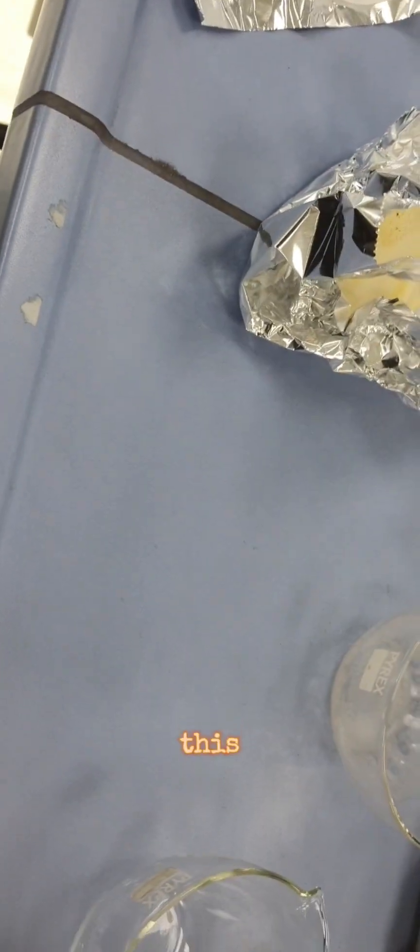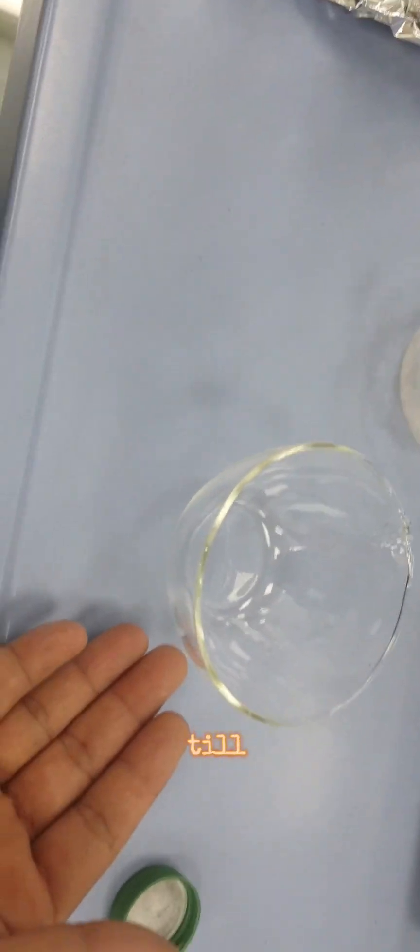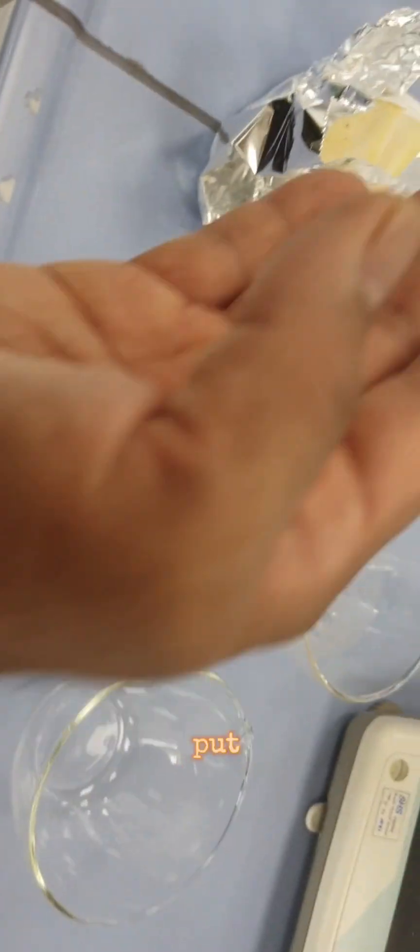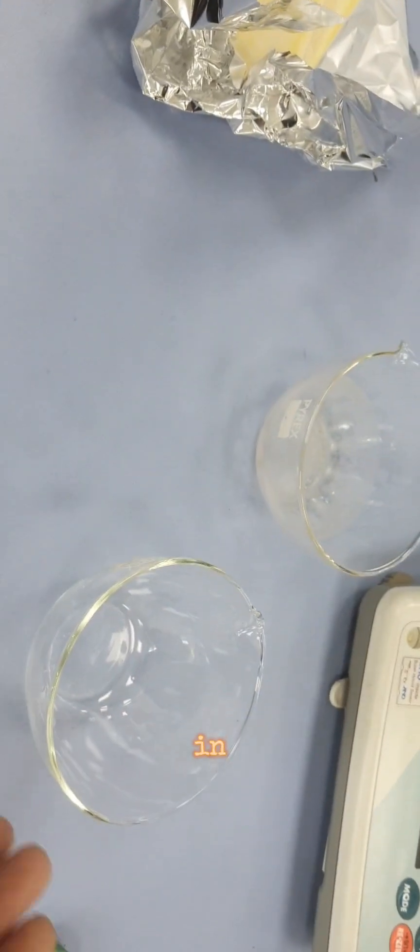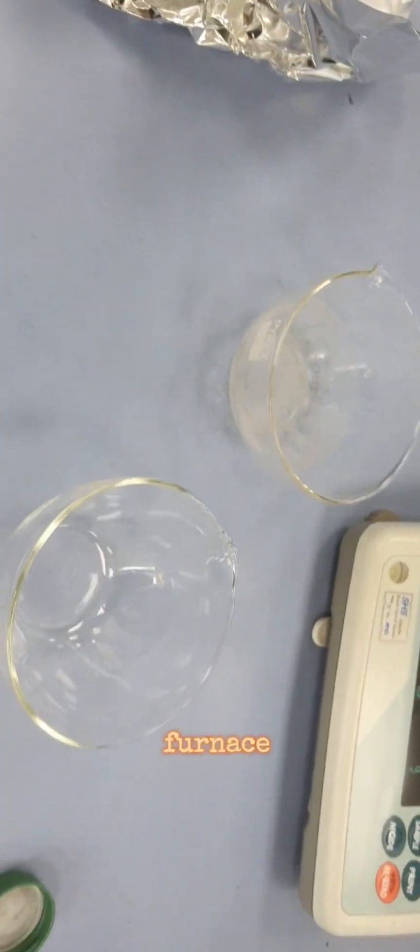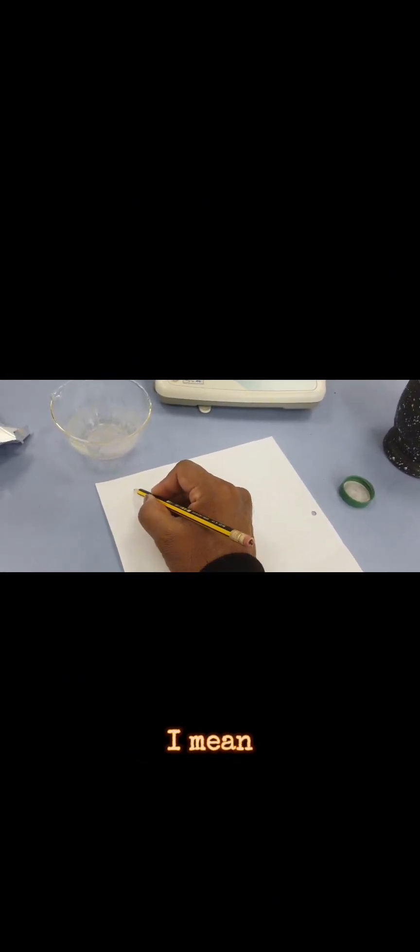I will weigh this. This is my crucible which can go till 750 degrees Celsius. I'll put these filters and weigh it, then put it in the muffle furnace. The weight here with the crucible is 60.82 grams for the first sample.